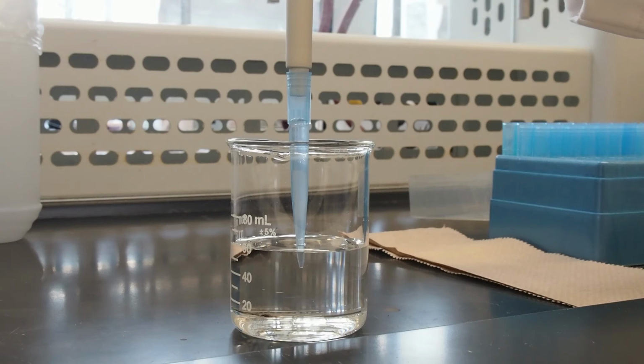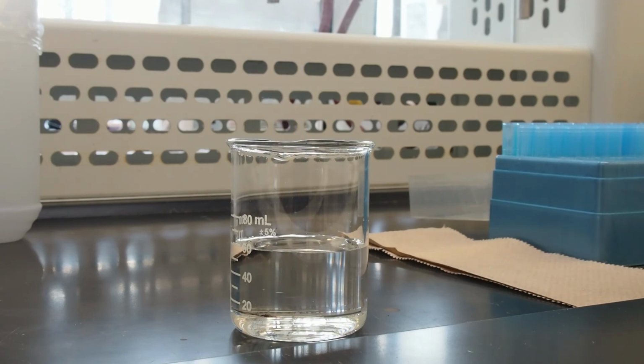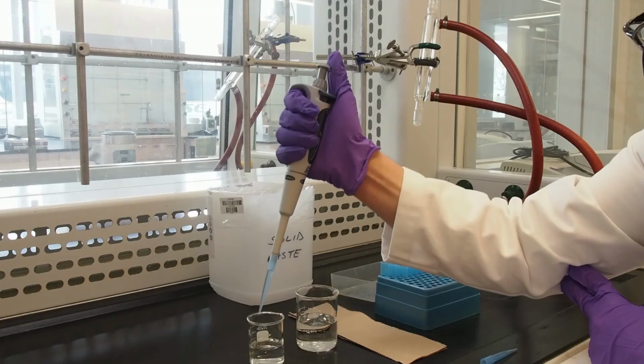It is good practice to prime or rinse the tip with the liquid before transferring. To do this, dispense the liquid back into the vessel by slowly pressing the button until the first stop, and then repeat the aspiration and dispensing process another 1 to 2 times. On the final rinse, dispense until the second stop to perform the blowout stroke.